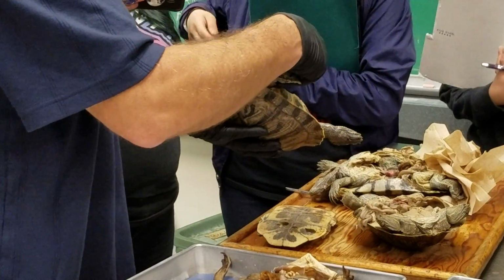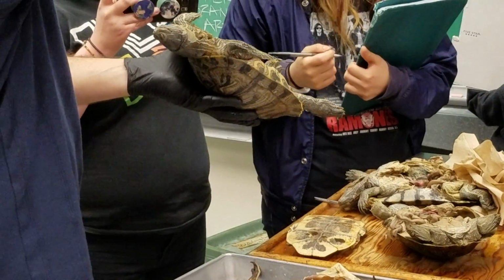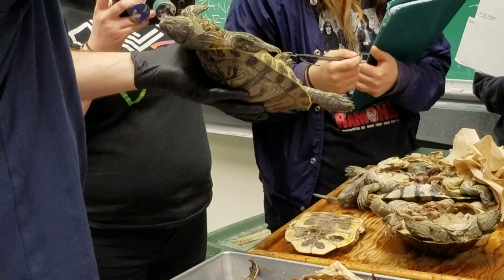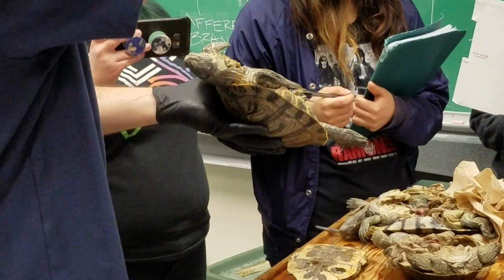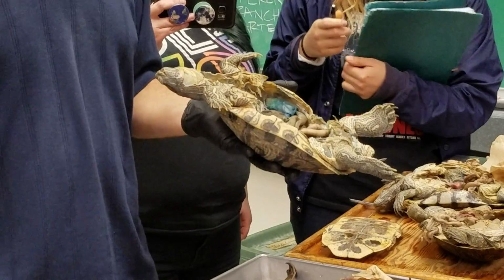There's the right systemic arch. Okay, and that's kind of what I tried to draw with my little silly V on the top there, showing how the paired dorsal aortae come together to form that single midline dorsal aorta. All right, you good?